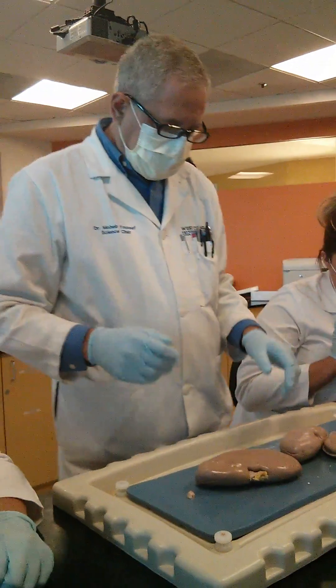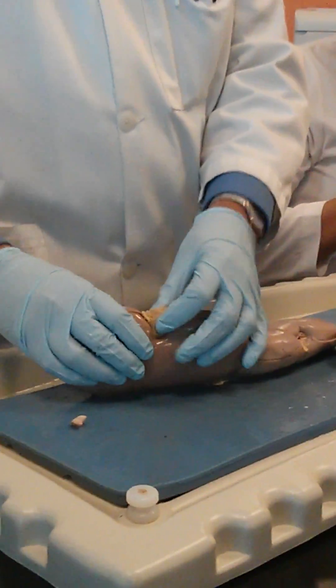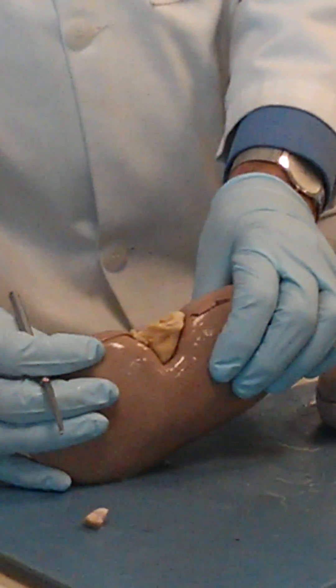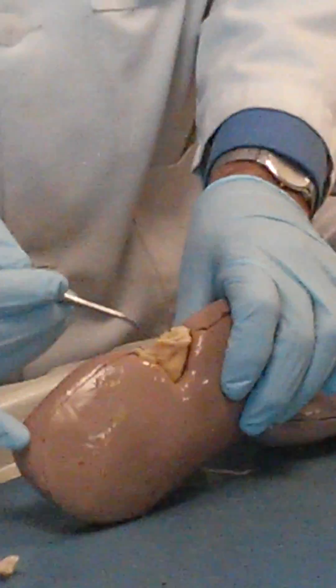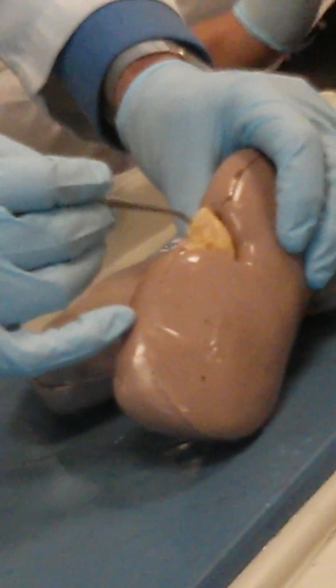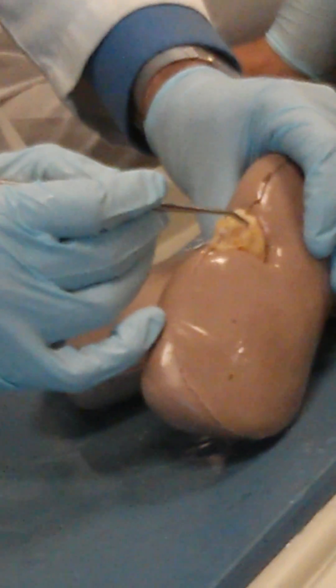The most important fact is that the kidney is retroperitoneal — behind the peritoneum. Now here is the hilum of the kidney as mentioned, with its three famous structures. When you look and apply your basic knowledge, you can see the three structures here. Try to decide which one is which — you can see a flat one right here.